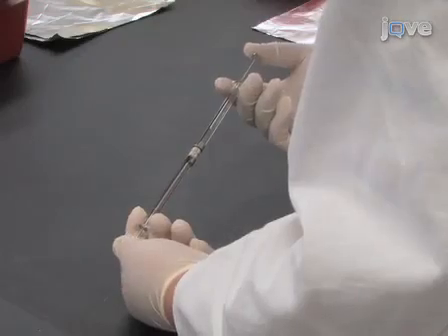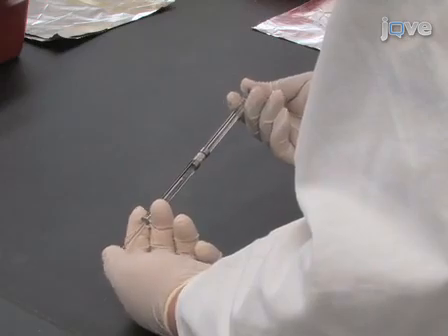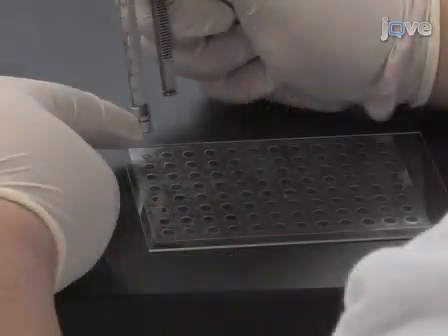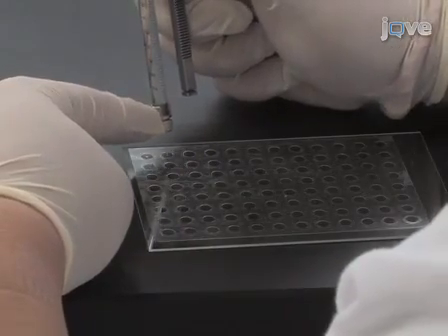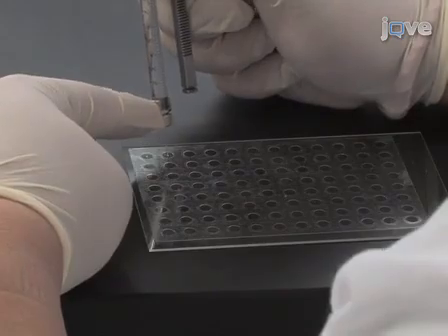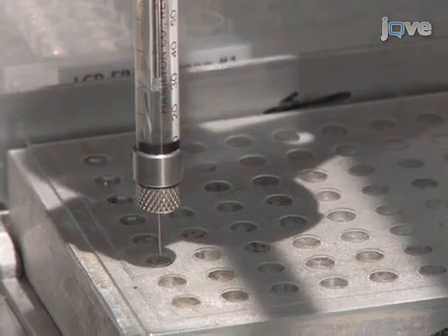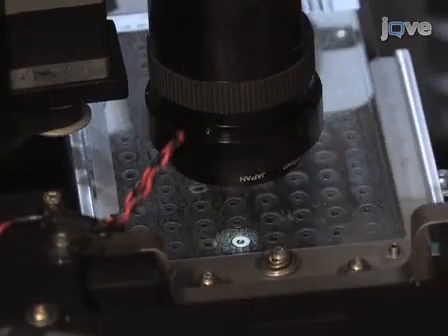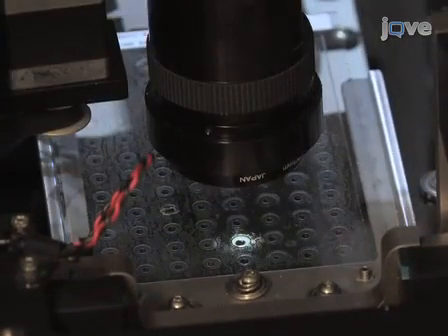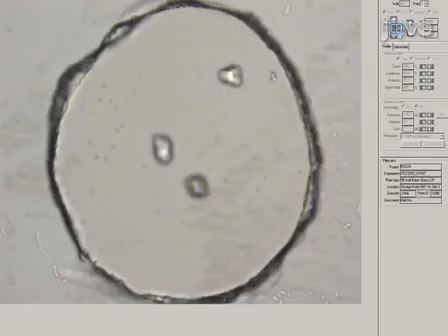To set up LCP crystallization trials, reconstitute the protein in LCP as before. Then, set up crystallization plates as for LCP FRAP but with crystallization screening solutions. Alternatively, crystallization trials can be set up robotically. Once crystallization plates have been prepared, incubate them at a constant temperature, periodically checking for crystal formation and growth.